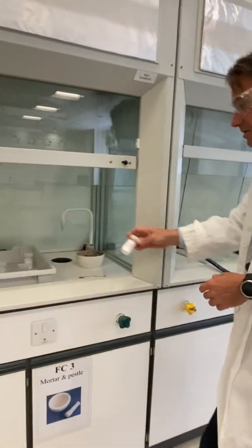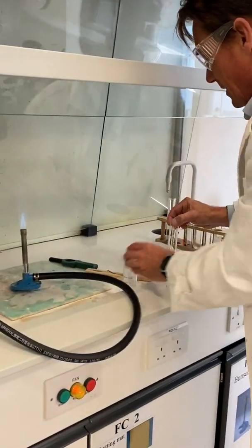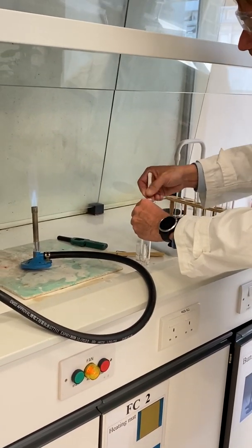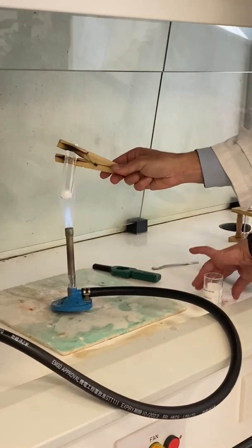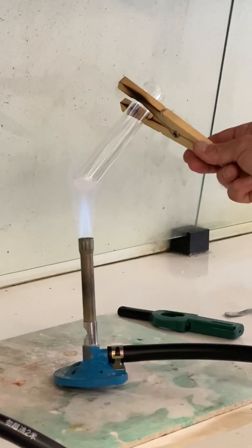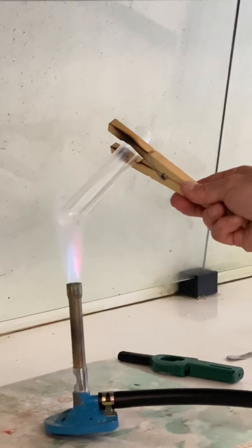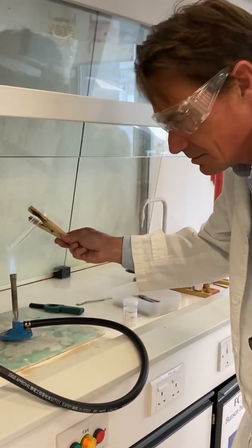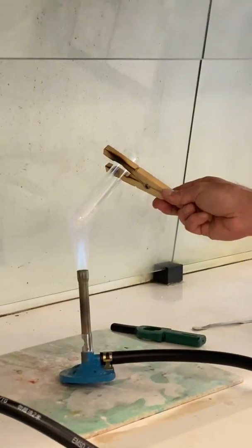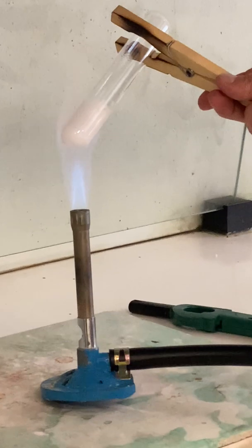Let me put the magnesium nitrate back and let's compare that with calcium nitrate — let's see what happens. This is slightly different to the group 2 carbonates. Once again, just some calcium nitrate now heating away. This is calcium nitrate — it's a bit harder to decompose, and there's a lot of water of crystallization again.